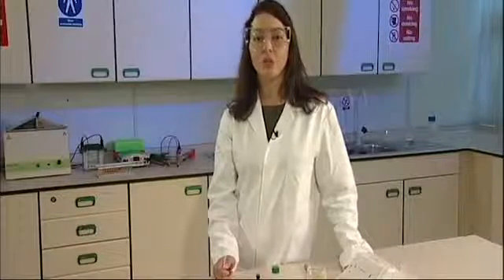Now it's time to streak the starter plates. Rehydrate the E. coli with 250 microliters, or a quarter of a mil, of transformation solution.